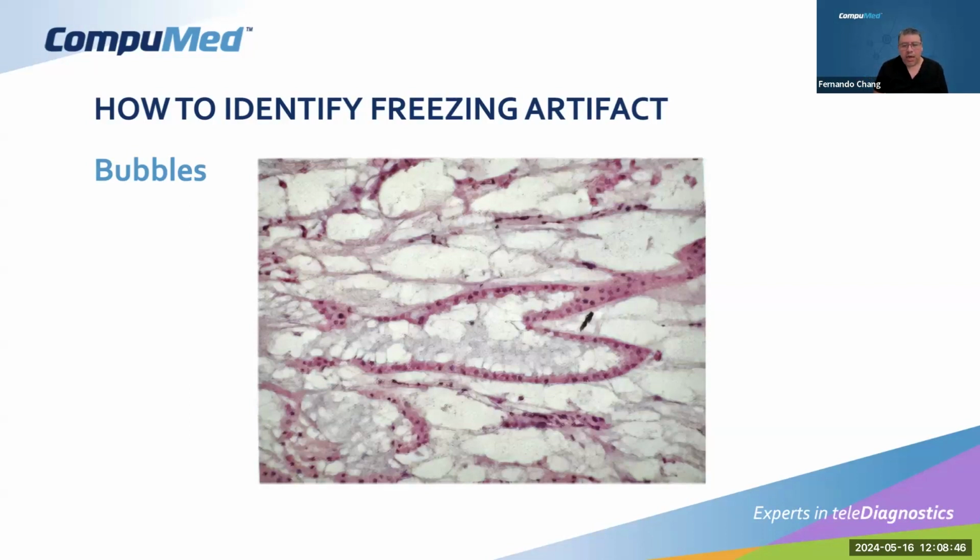Our trained pathologists are obviously going to determine that this is not fatty tissue, because fat actually looks in this way. The translucency of fat in light microscopy and H&E staining looks in this way. But for the trained eye, our pathologists will determine that this actually is the bubble type freezing artifact. There was a lot of water content, and all of a sudden everything freezes and compresses the tissue around it and leaves spaces when we go through the different stainings and washings from water to alcohols. This creates the appearance of fatty tissue when it's really not fatty tissue, like we're going to see in the cases.